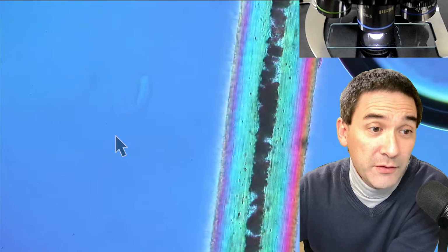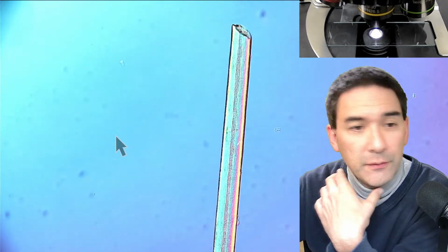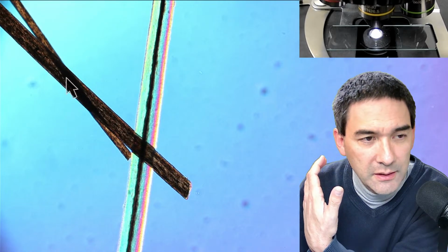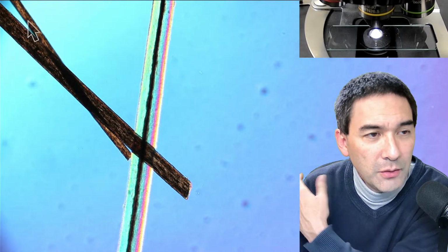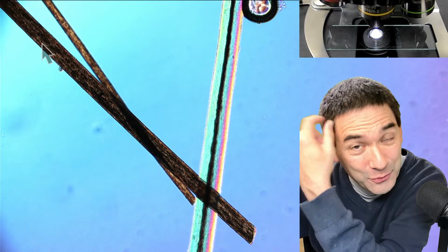Because apparently, even though there are a lot of pigmented cells in there, as we can obviously see, I just want to show you. I need to make this darker again a little bit so that the whole contrast is better. I have to find some of the other hair. Look, it's interesting. Over here, it's completely white. Let's go down. It becomes darker, darker, darker. But look, this is one of my regular black hair, right? It's actually not just the inside, but the whole hair that has the hair color. And look at how different it is basically from my gray hair. Look how different the thickness is. So this is something I just wanted to show you, because I found this kind of remarkable, this big difference between gray hair, the few gray hair that I already have, and the black hair.